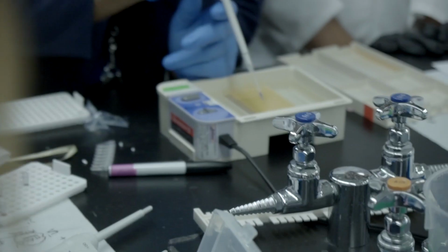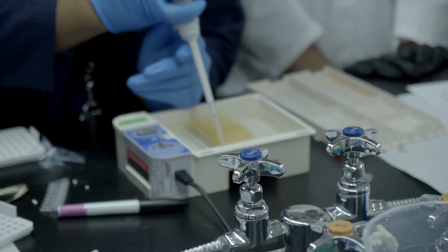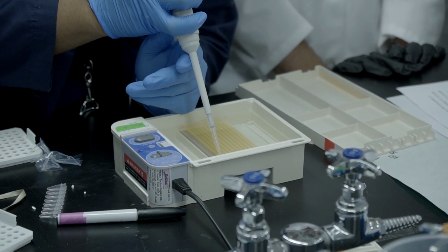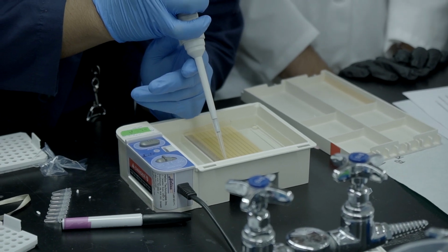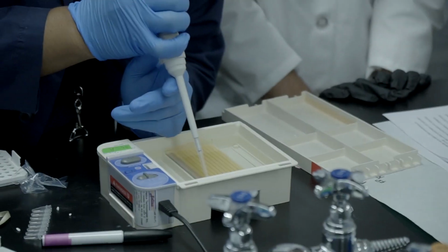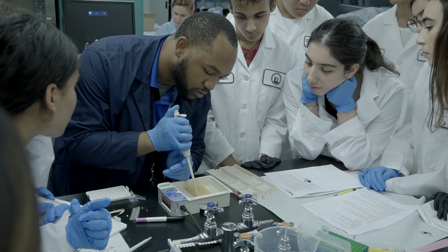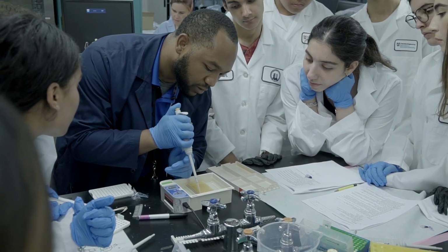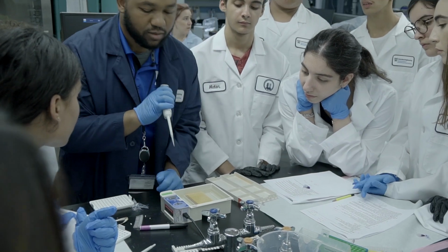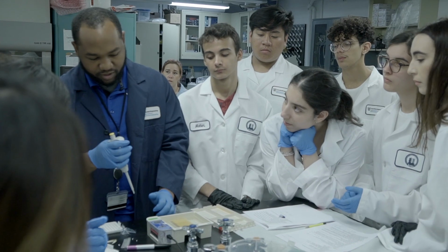I'm going to kind of use my hand if I need to stabilize things, all right? I'm going to insert slowly, make sure I'm actually inside the slot and not outside of it. I can steadily look to make sure it's actually inside the hole. And I'm going to slowly make sure while I'm submerged. Slowly inject. And then after I'm done, I pull up slowly. Okay. This, I will admit, usually takes some time to get really good at.